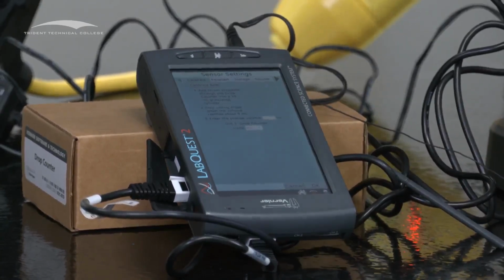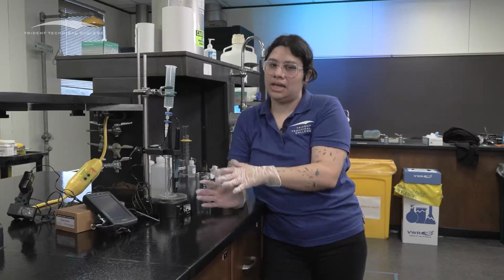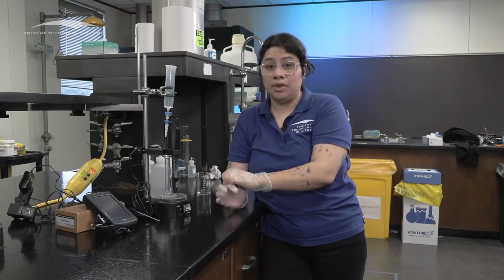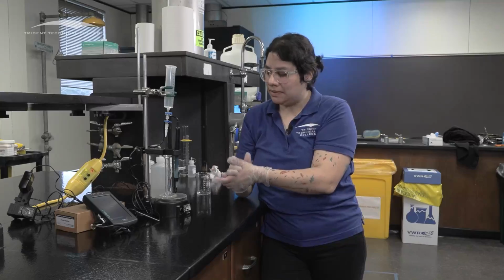Now, this is going to be the one that's going to decide your flow rate. It's going to be the one that decides how good your measurements are going to be. So take your time with this one. This is going to be the most important one. And then once you figure out your flow rate, don't move it. Once you calibrate it, don't move it. You can move anything here. You can move this up and down, but don't move anything else, right?